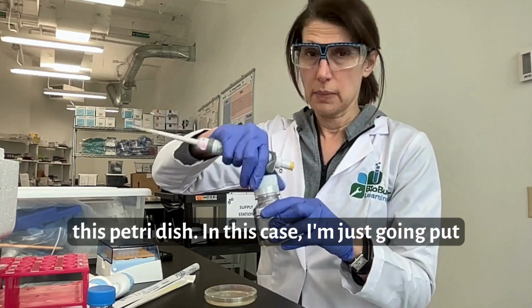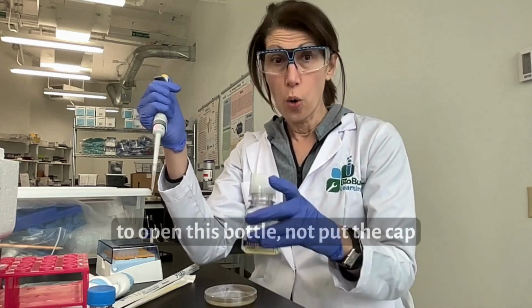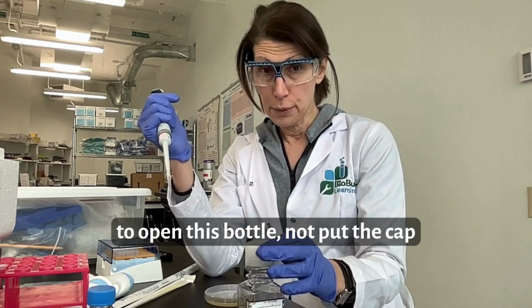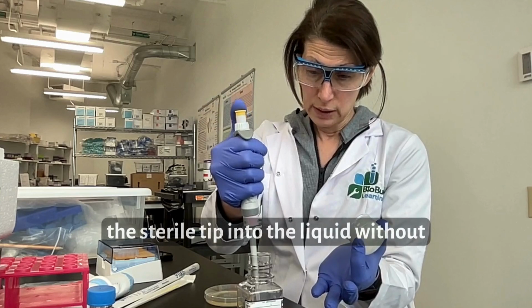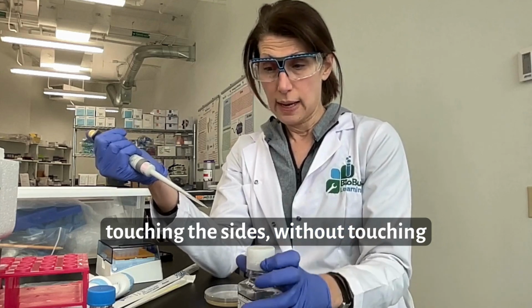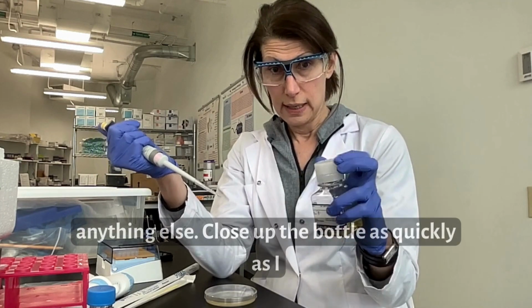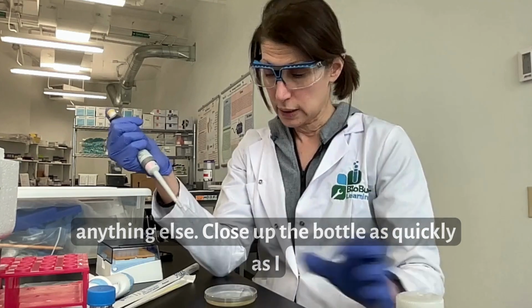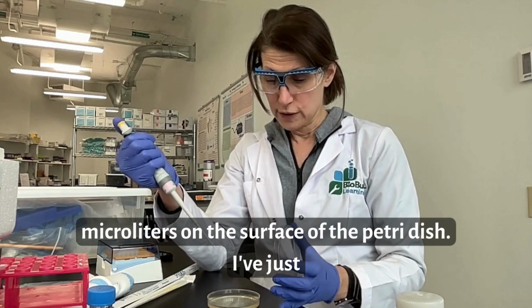In this case, I'm just going to put some LB. I'm going to open this bottle, not put the cap down onto the bench, keep it in my hand, put the sterile tip into the liquid without touching the sides, without touching the bench or anything else, close up the bottle as quickly as I can, and spread that 20 microliters on the surface of the Petri dish.